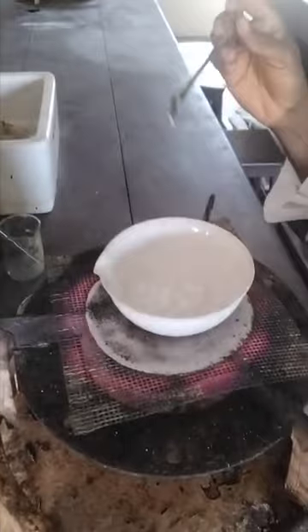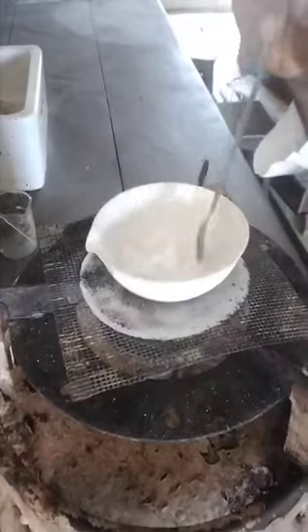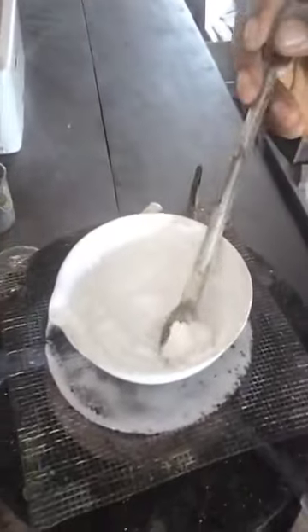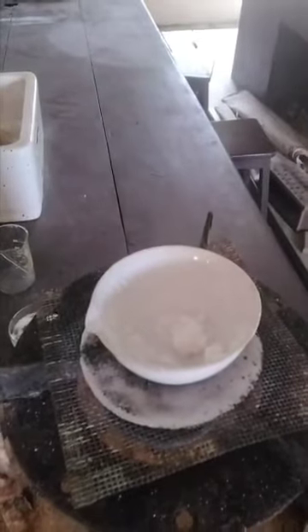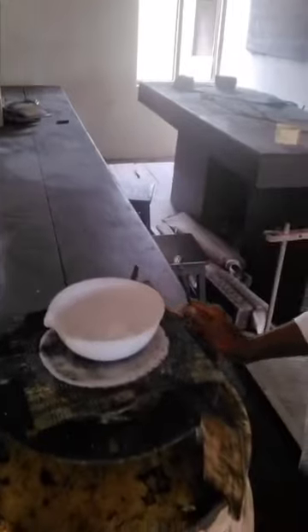Okay, so we'll turn off the gas now. Can you see it now? Turn off the gas and allow it to get cold. Are you seeing the salt? Yes, ma'am. So you'll be asking, where is the water? The water has evaporated. So we can say that we have sacrificed the water. Okay, so we have ended up with the practical, evaporation to dryness.